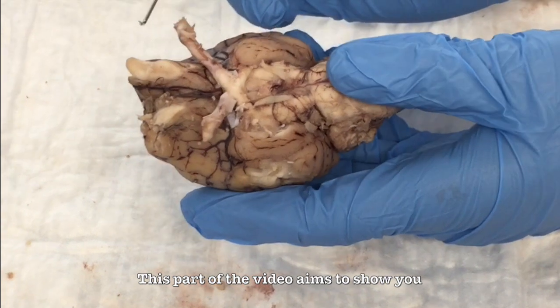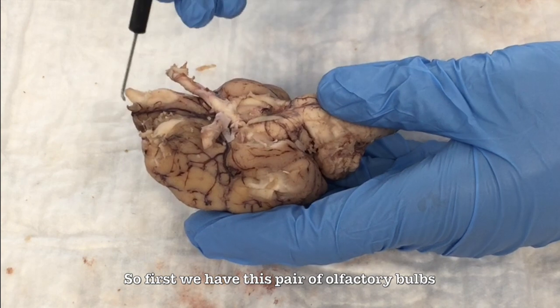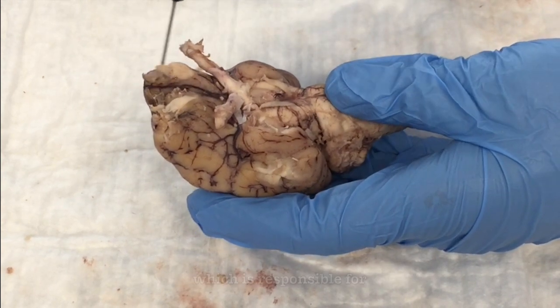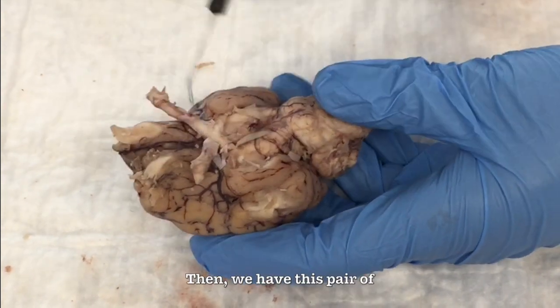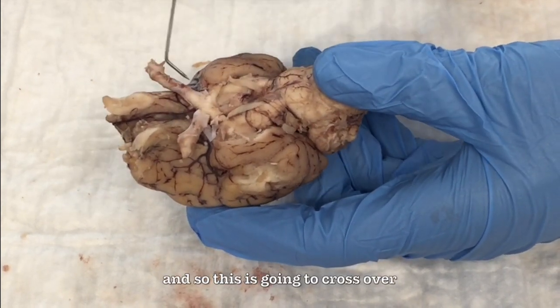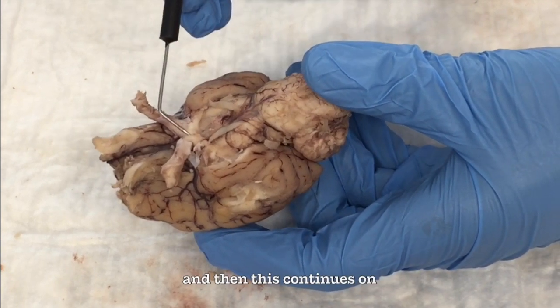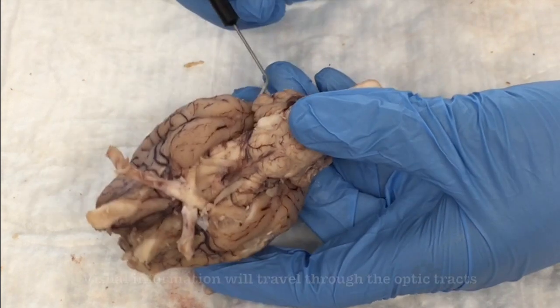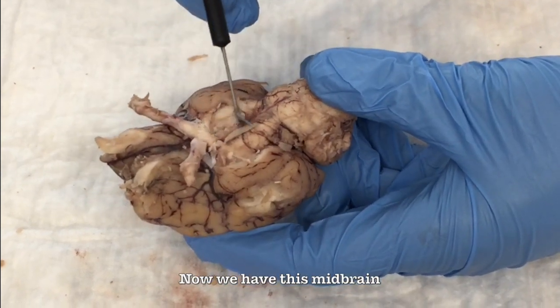This part of the video aims to show you the structures of the brain that are visible from the inferior aspect. So first we have this pair of olfactory bulbs, and this gives rise to cranial nerve 1, which is responsible for the sense of smell. Then we have this pair of optic nerves, and so this is going to cross over at this X right here, the optic chiasm, and then this continues on into these optic tracts. Visual information will travel through the optic tracts and eventually end up in the occipital lobe. Now we have this midbrain.